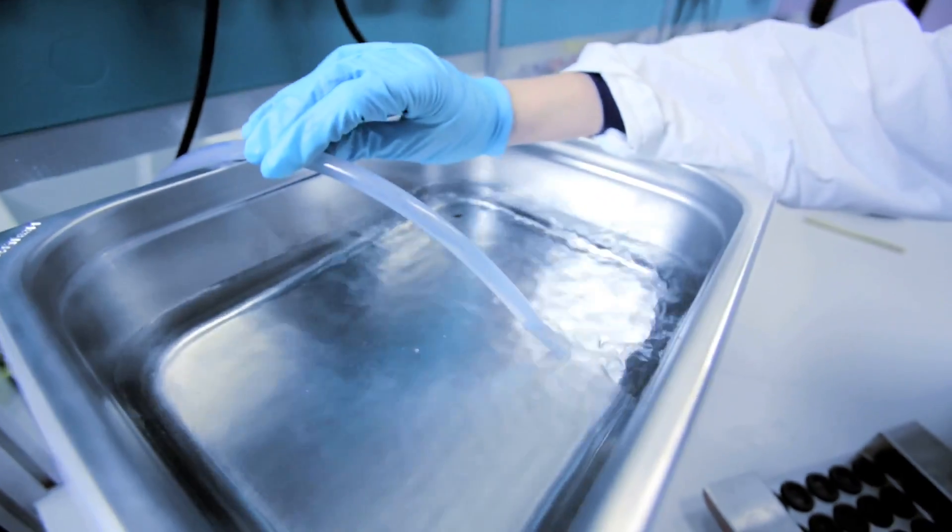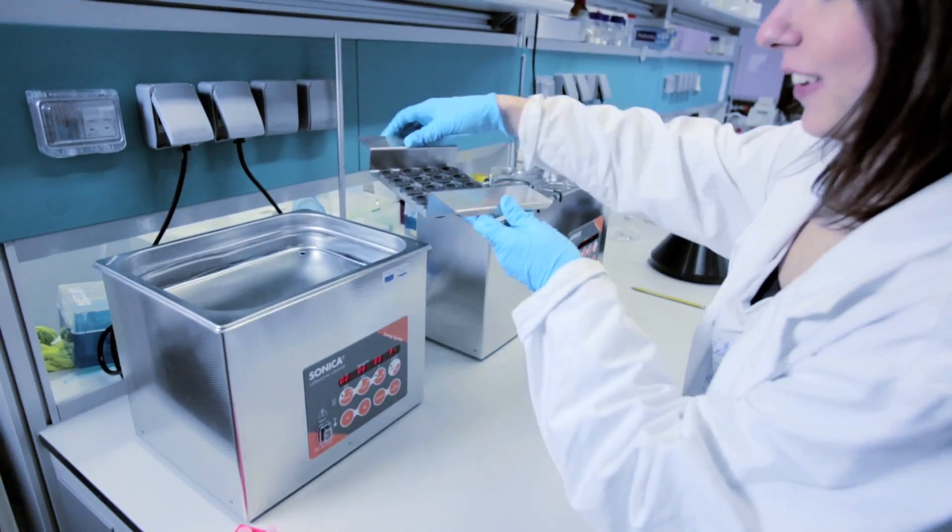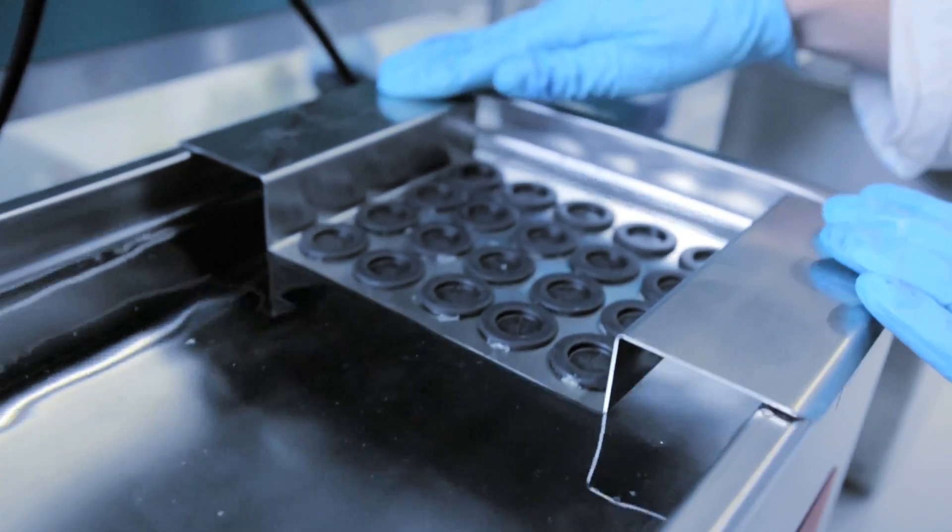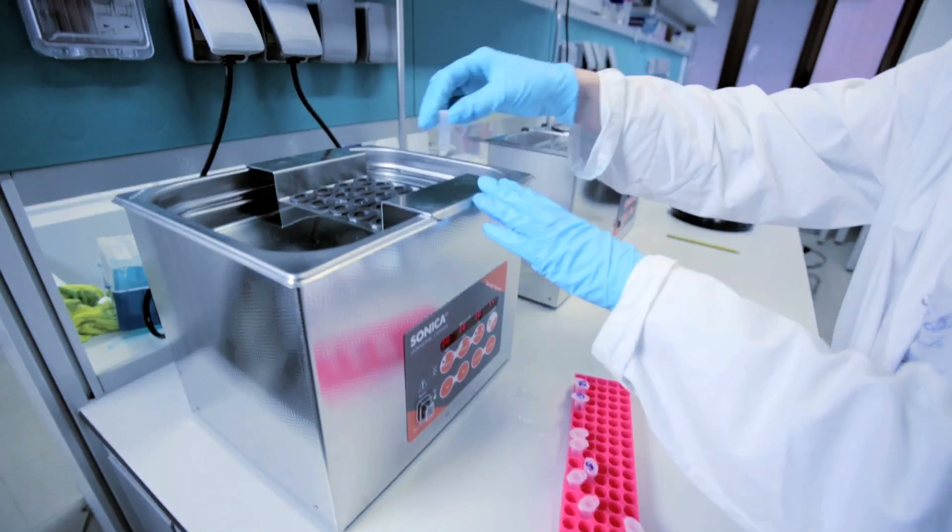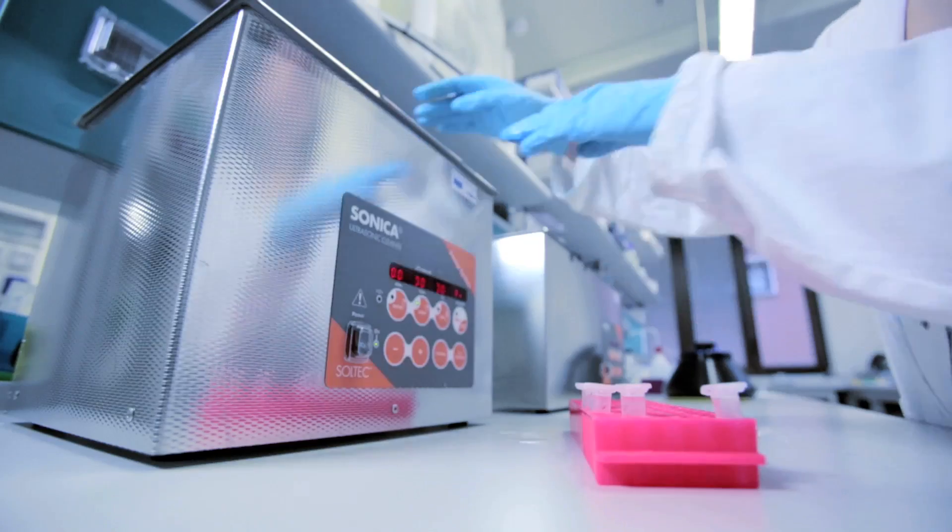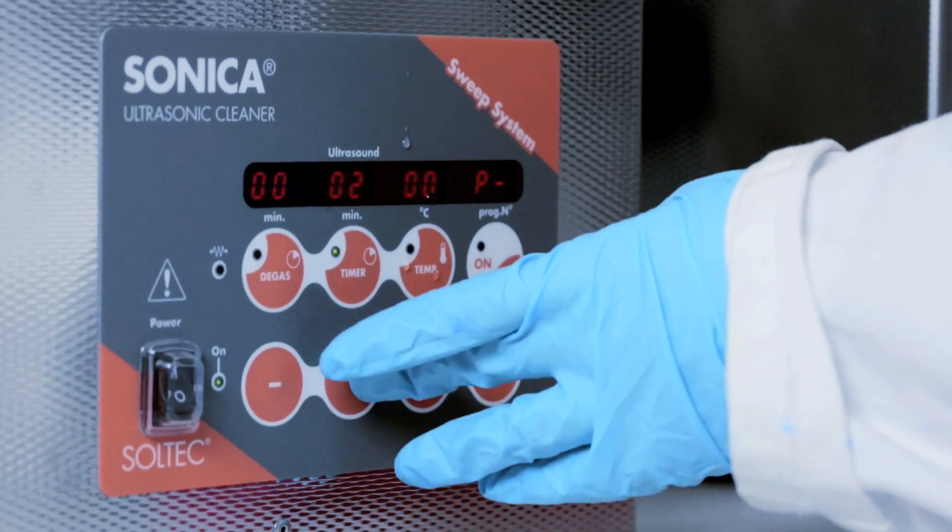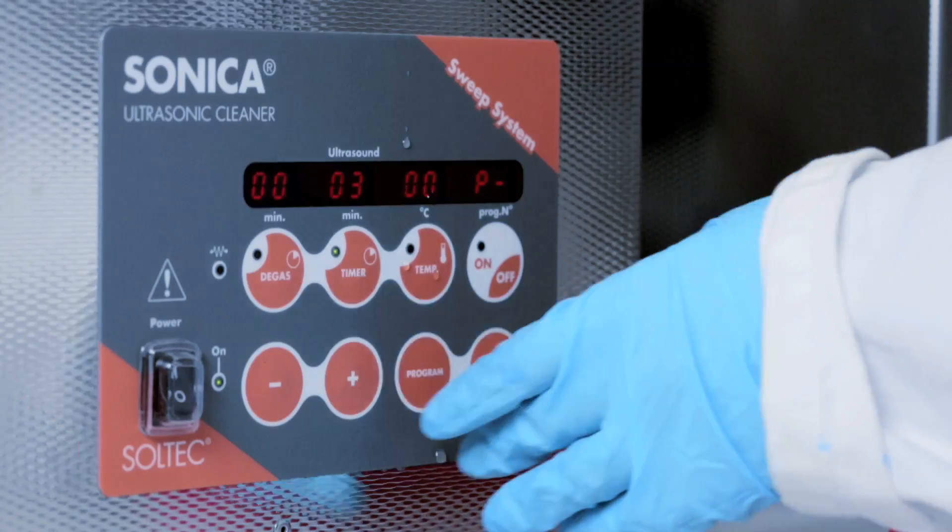When we use the ultrasonic bath, we fill it with water, put on a specific device designed to sonicate the sample inside the centrifuge tubes, and we set the time between 3 to 15 minutes.